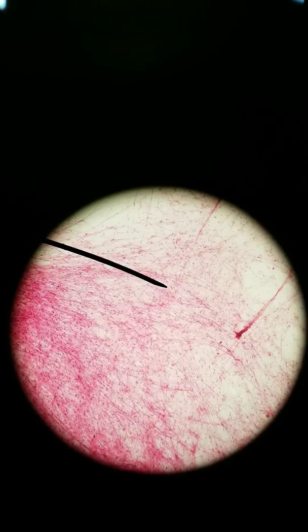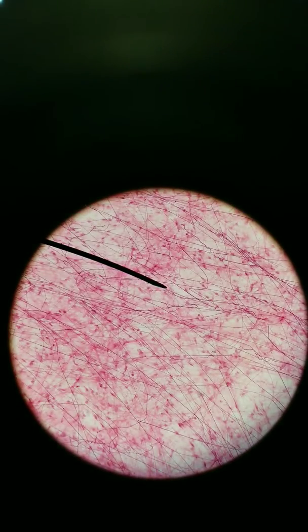I know this looks a lot like the neuron stain, but we don't see those large branched cells here. It's just a lot of small nuclei, and those fibers you see are protein fibers, things like collagen, elastic fibers, reticular fibers. Going at 100x, here you can see the nuclei more clearly. Those are fibrocytes and the different types of fibers within this connective tissue.